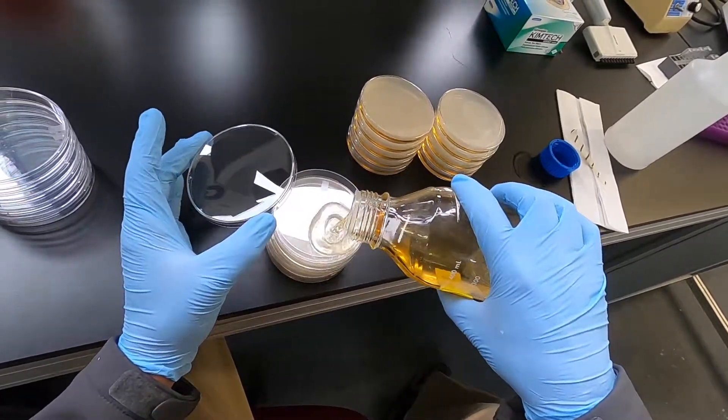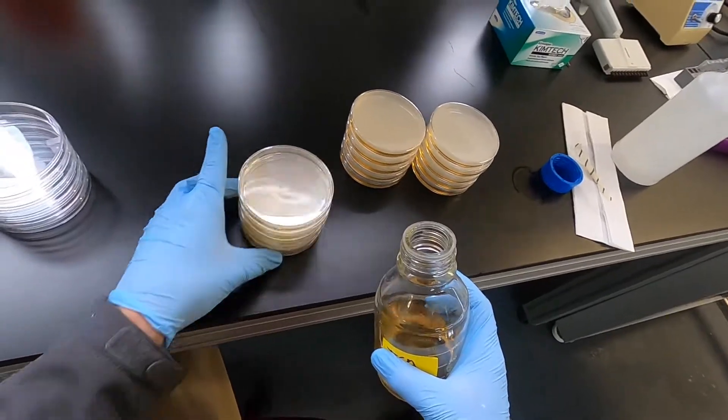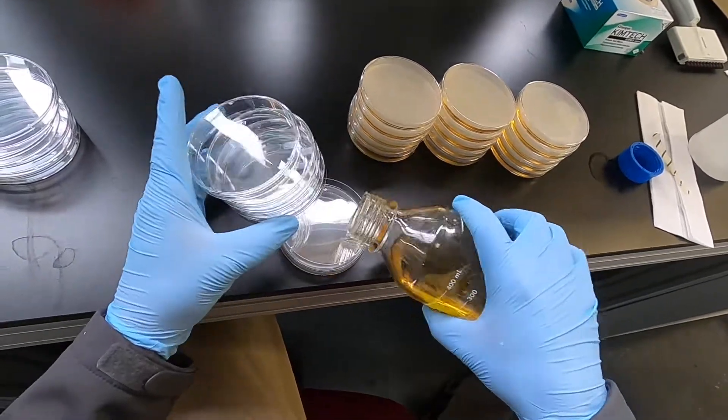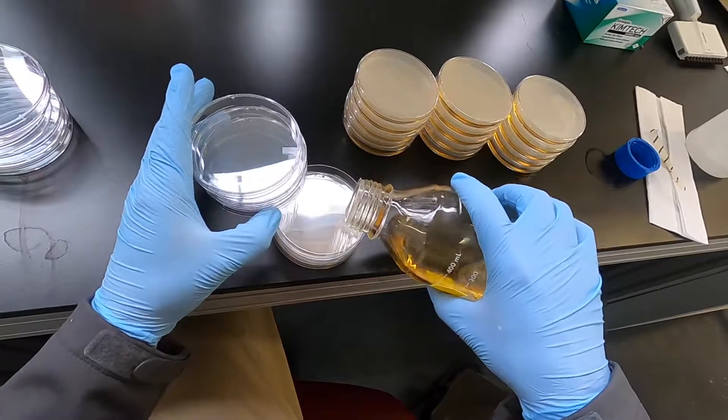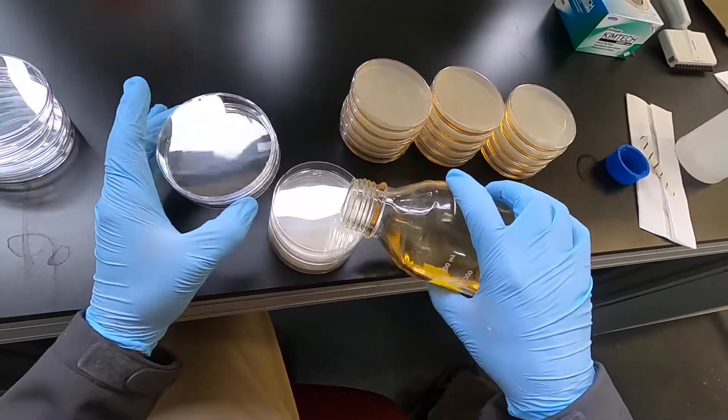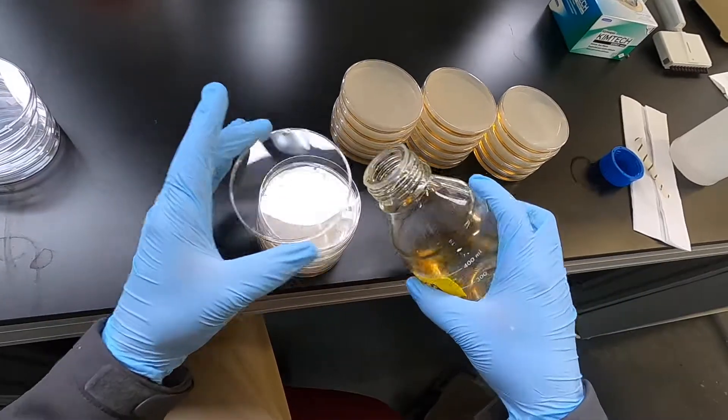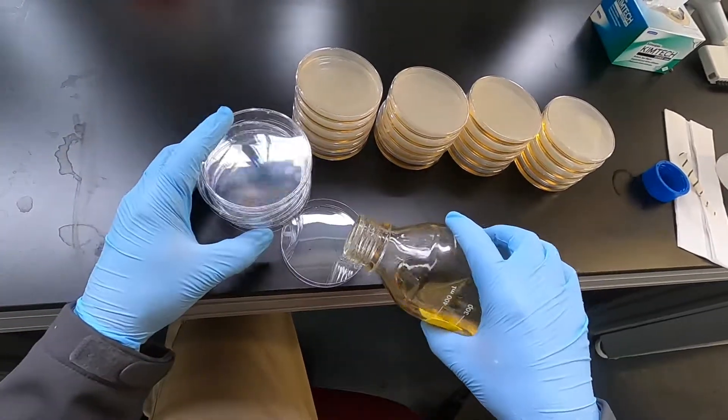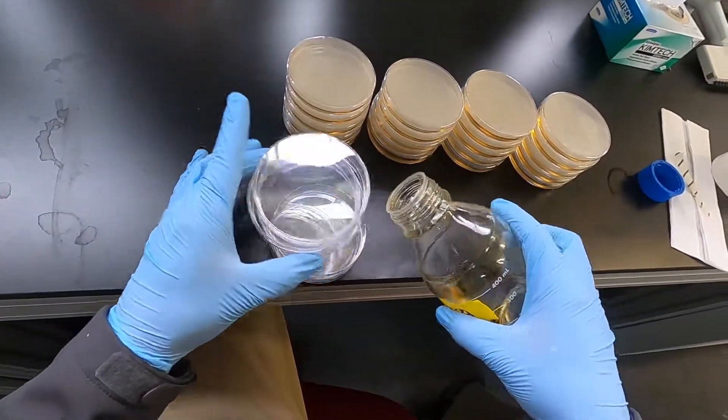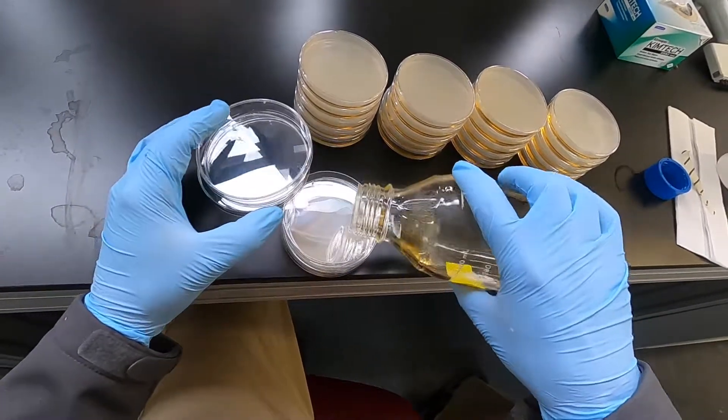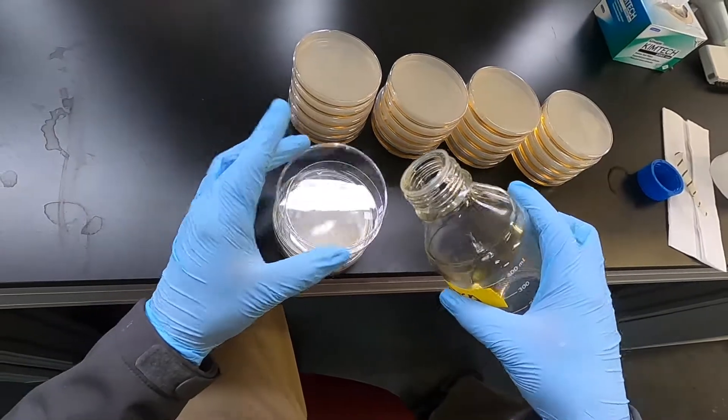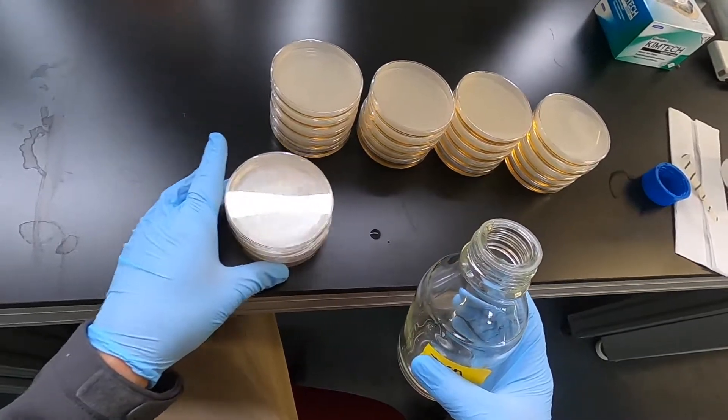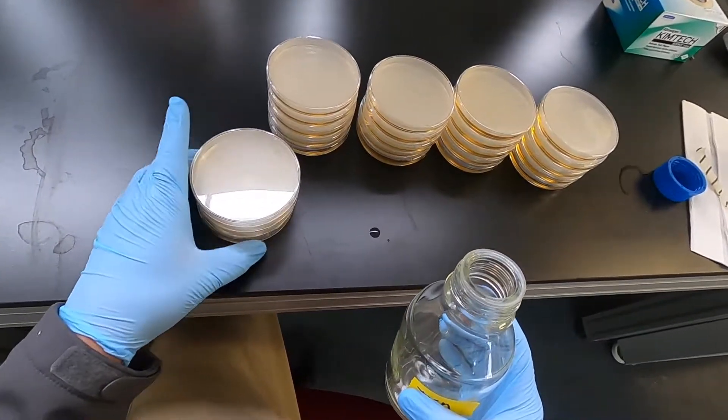Without being short and without going over. I have a feeling I'm gonna be under. Not too bad. A couple short plates, a couple of too much, but that's it.